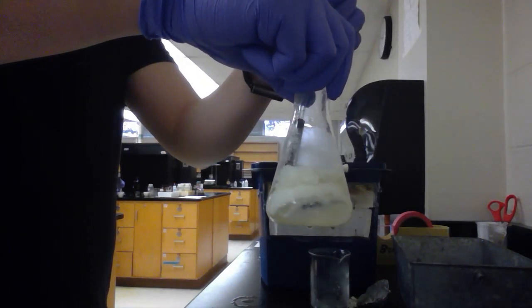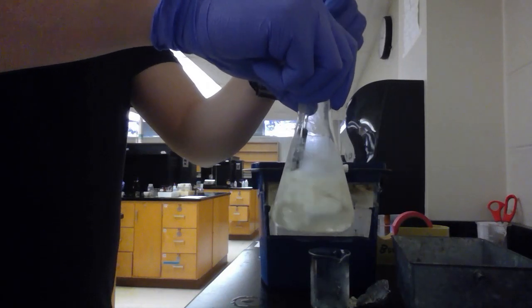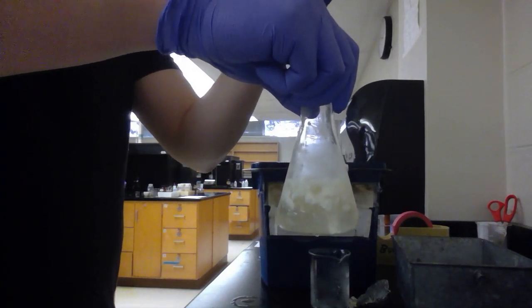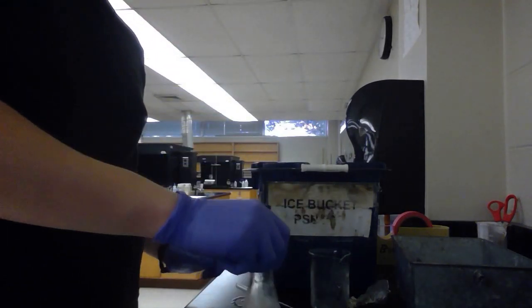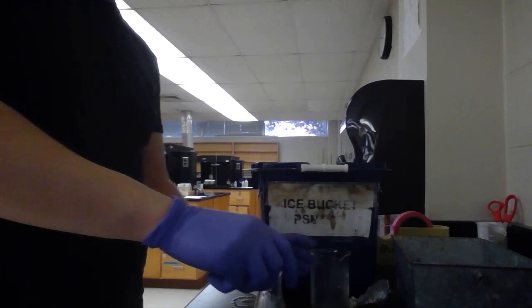There you can see the soap, after we agitated it, has floated up to the top. And we're going to decant the liquid off as best we can, so we can isolate the soap.